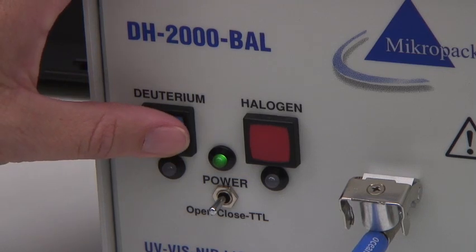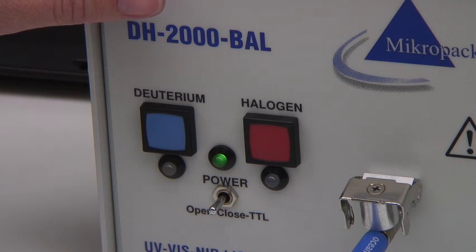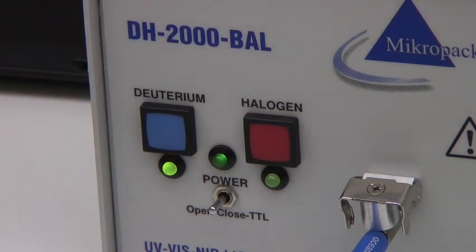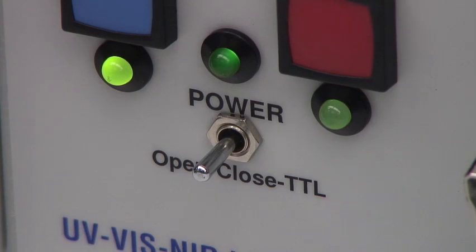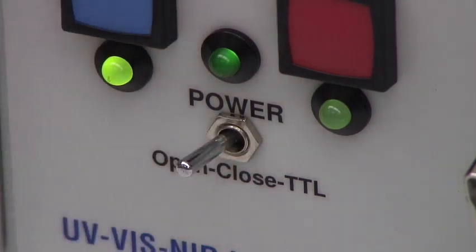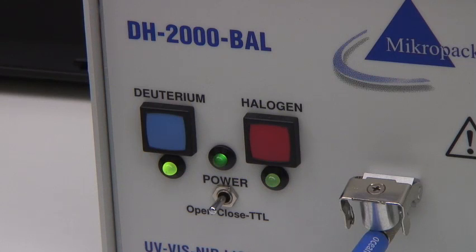Turn on both the deuterium and tungsten halogen bulbs. Press the blue button for deuterium and the red button for tungsten halogen. The deuterium blinks for a few seconds due to a gradual ramping of the voltage. Once both bulbs are at full power, the LED indicators below the buttons will stay solid. With both bulbs powered, open the shutter by clicking the toggle switch into the far left or open position. Use the toggle switch for manual control of the light source. You should hear the click of the magnetic shutter when you throw the switch. It usually takes between 20 and 30 minutes for the light source to warm up completely.